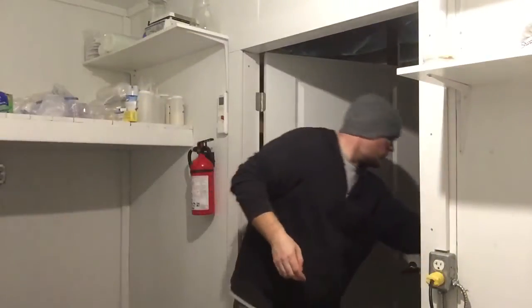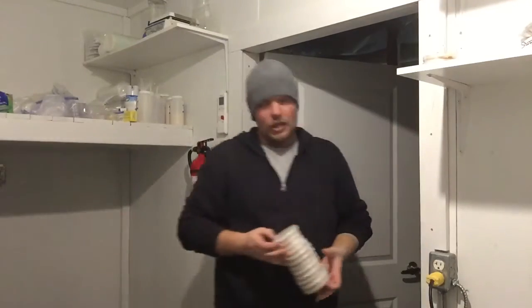So I'll bring you in the lab and I'll show you what we're going to do with these jars. So I already have 42 jars sterilized right here. So that's one batch. We usually do 2 batches in a day for 84 jars if we can. So what we're going to do, hopefully tomorrow, is inoculate a couple different strains here.